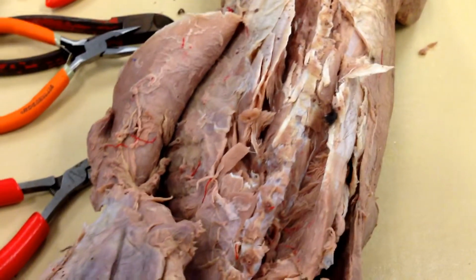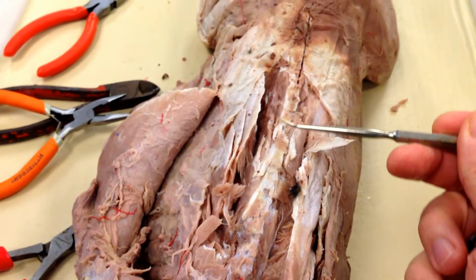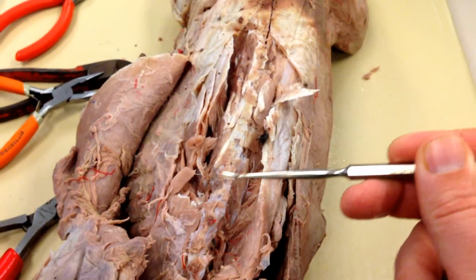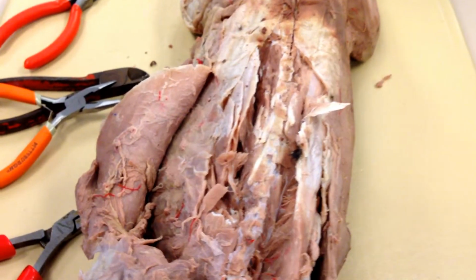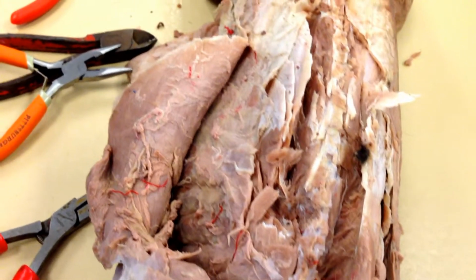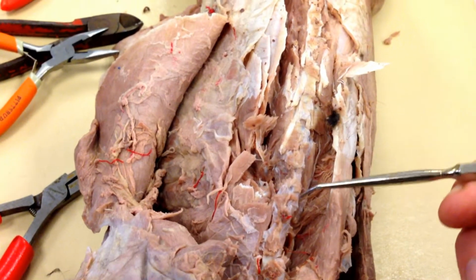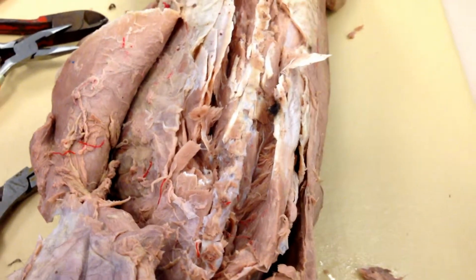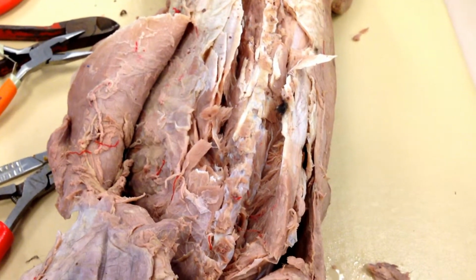All right, 56. This bony structure going all the way down the back of the cat. 56, what is this bony structure called? 57. There is a stripe of nervous tissue down that same structure. If we were to have cut that in half, we would have seen a stripe of nervous tissue. What's that called? That's 57.